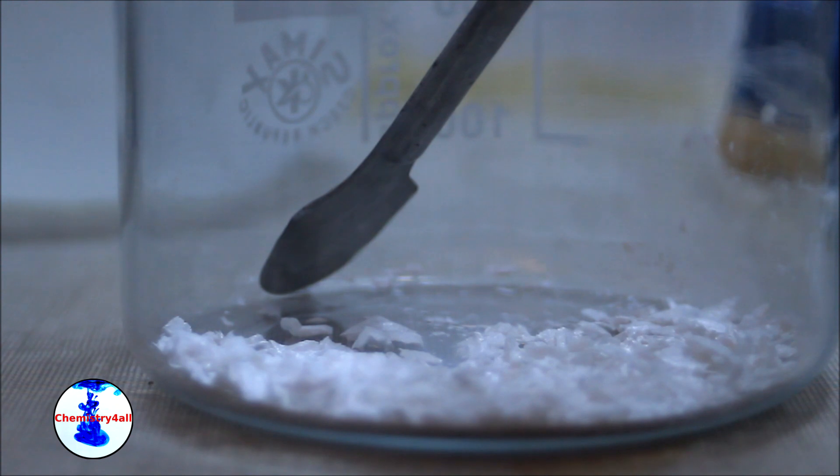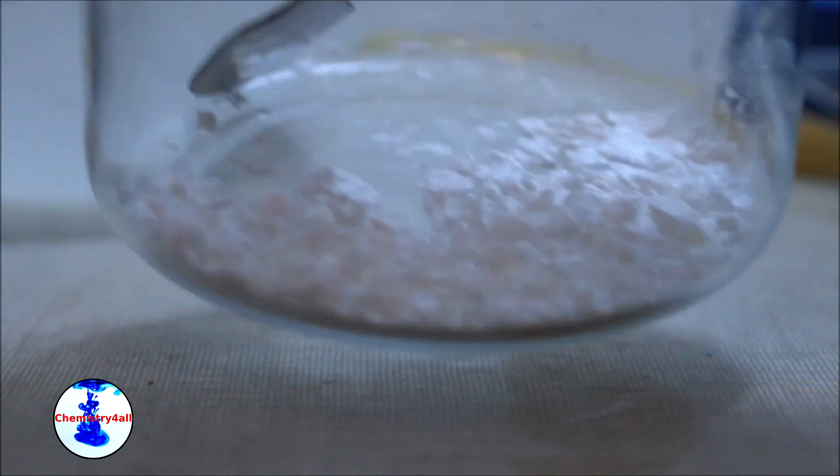The white precipitate obtained is finally filtered under vacuum, washed with distilled water and allowed to dry overnight.